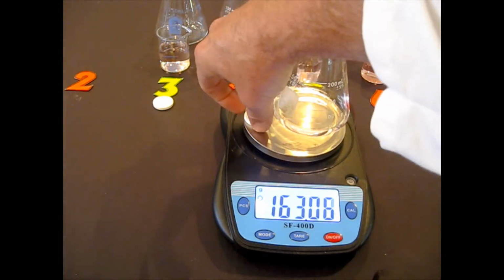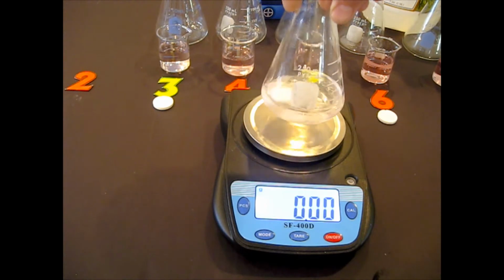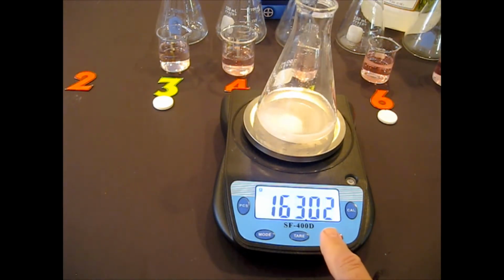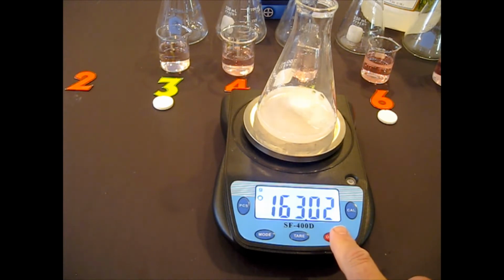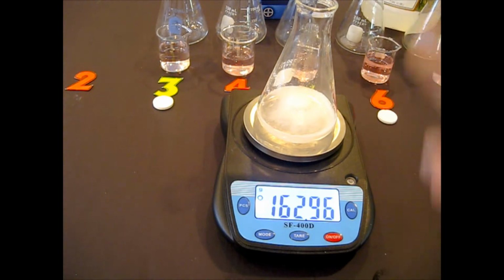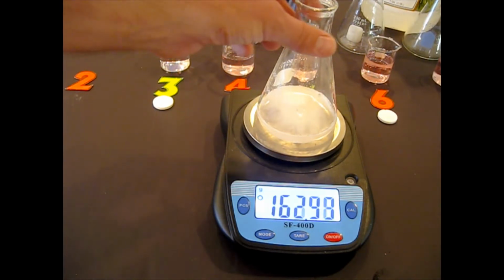Okay, then I'm going to plop it in, and then we'll get D later when this reaction has completed. I'm going to get it going there, but you can watch the number. It should already begin to drop. Remember, this number is going to get lower. So we expect D to be lower, even though there's conservation of mass. Notice some of the gases are going out. Okay, it's happening very rapidly. Okay, so that's number 2.